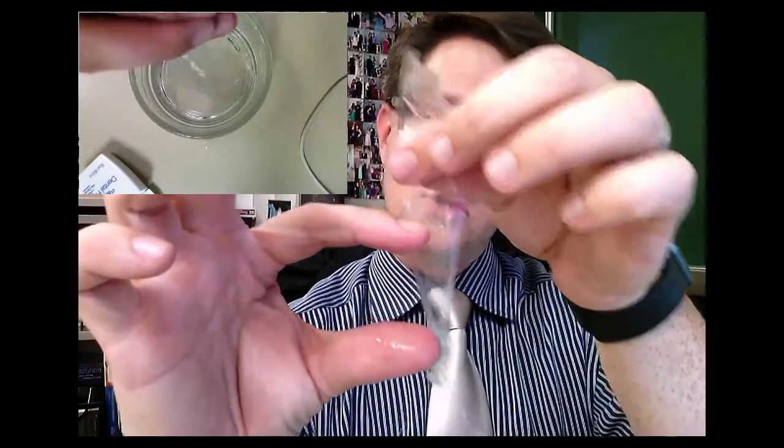What you now have is hopefully a leak-proof end. You can put liquid in on this side and it'll fill up. You don't want it filled all the way — maybe two centimeters worth — then tie it off. Don't make it super tight, because if water is coming in because you're putting it into a hypotonic solution, you don't want the bag to burst. It's okay if it's a little squishy and bendable. Fold in half, fold in half again, fold over, add floss — and you're good to go.